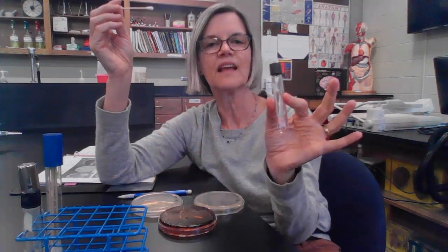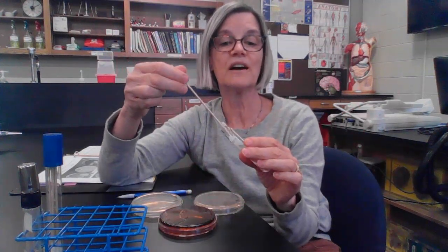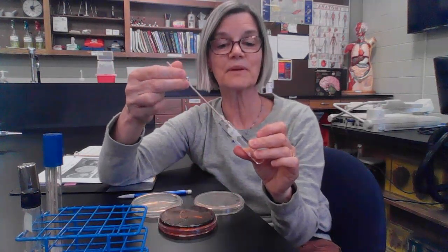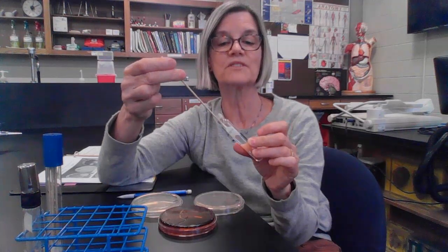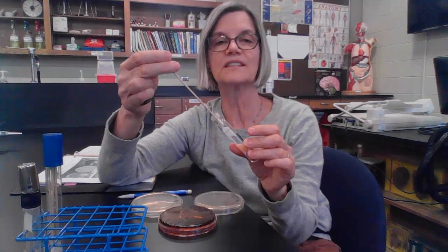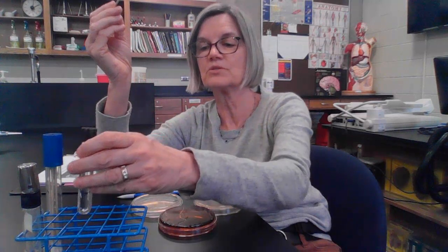The other thing I have here is some sterile water, and I'm going to unscrew that. And remember, it's just easier to pick up dirt or something from a surface with a wet cloth than it is to pick it up with a dry cloth. So that's the only reason why I'm moistening my swab, is just to pick up more microbes. I'm just going to squeeze out a little bit of the water on the inside. And again, because I want this water to remain sterile, I'm going to close it right back up.